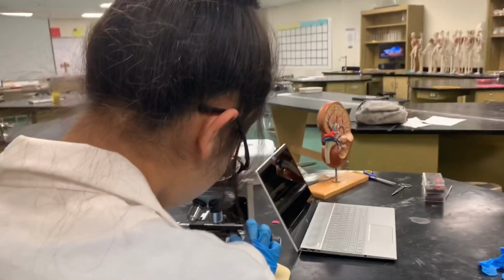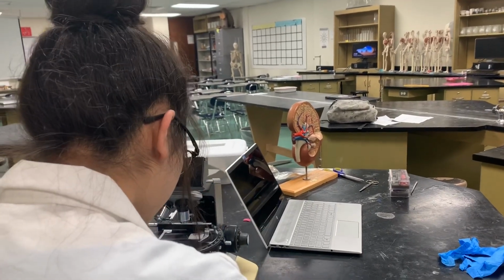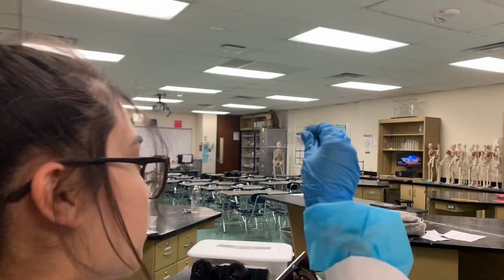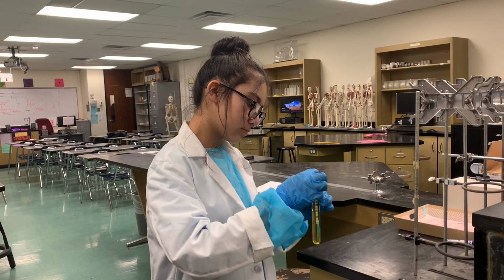There are a variety of changes that occur in tissue after death. Pathologists want to study these tissues in a form that is as close as possible to what they looked like in their living state. Thus, as quickly as possible, tissue samples must be fixed, which means that the processes that naturally occur in decaying tissues are halted.